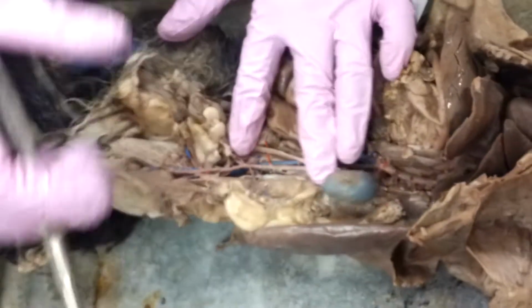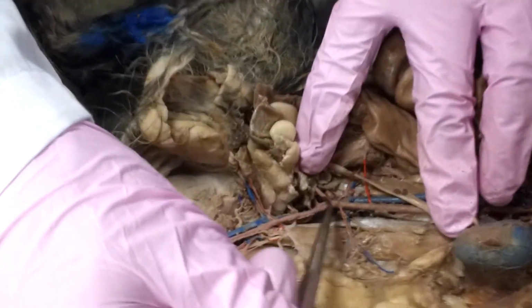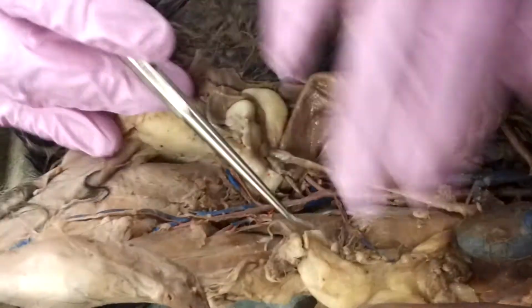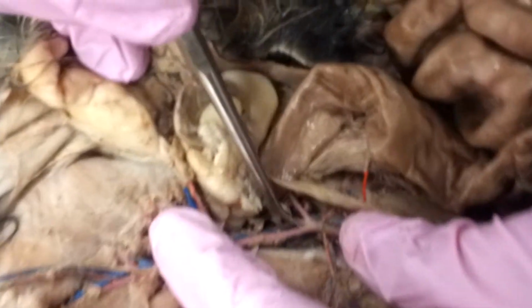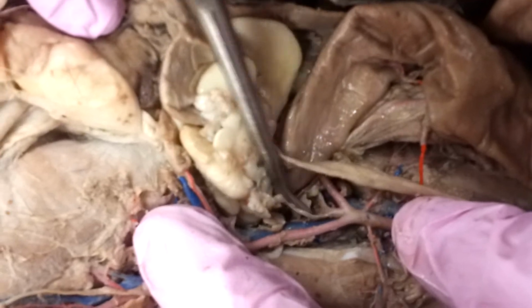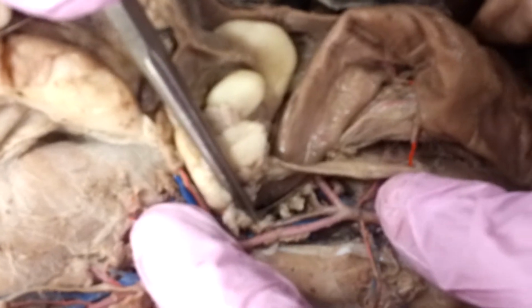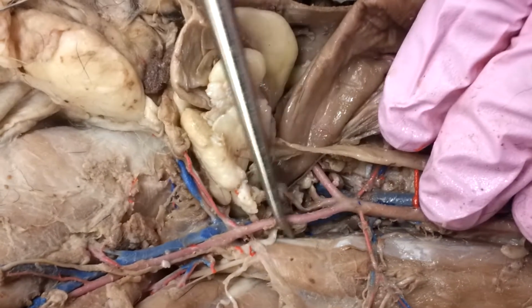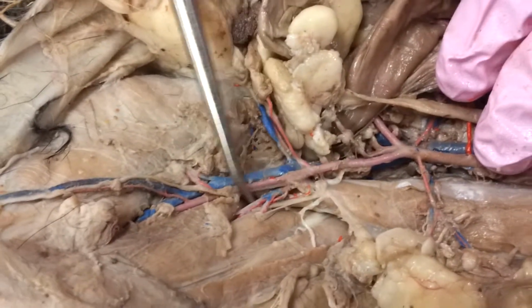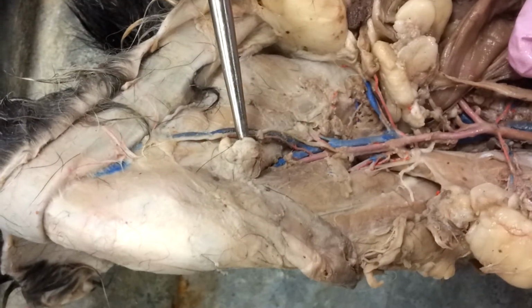Now, we've got our descending aorta branching into our external iliac, right? No common iliac in the cat, external iliac. Take a look right down here, and then a little further down, we've got that internal iliac. So we've got external, branch down, internal iliac going to the pelvis. Really nice picture on this cat. Now, external iliac goes into the femoral artery, which is going to be in the thigh, and then it dives deep into the knee, which is going to be the popliteal artery.